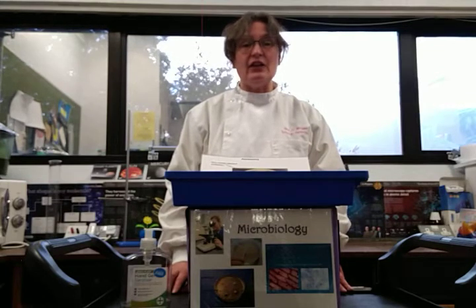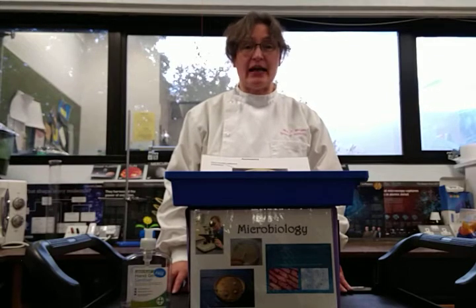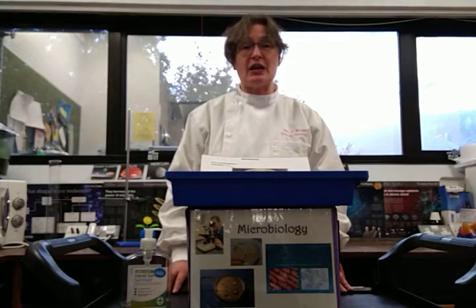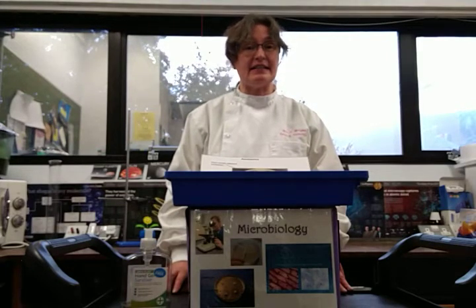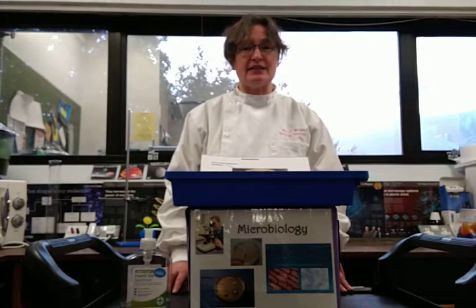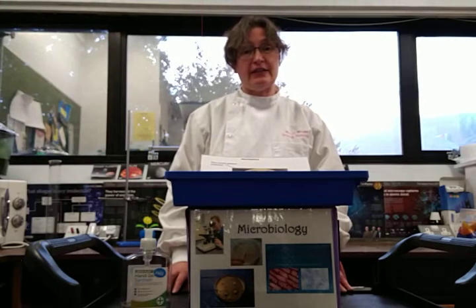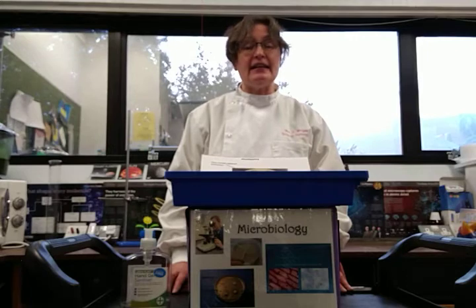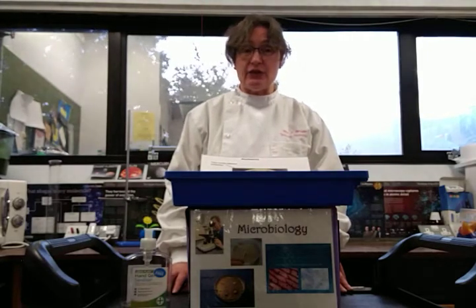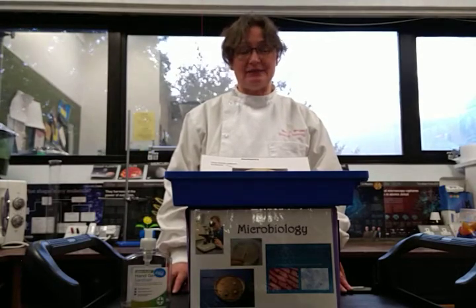The bacteria that we're using for this investigation is called E. coli K12. You may have heard of E. coli and heard that it can cause some very nasty sickness in humans, and that may alarm you to think that we're using that in school. Well, let me reassure you, there are many different strains of E. coli and this strain is not harmful to humans. The antibiotics we're using are penicillin and streptomycin.